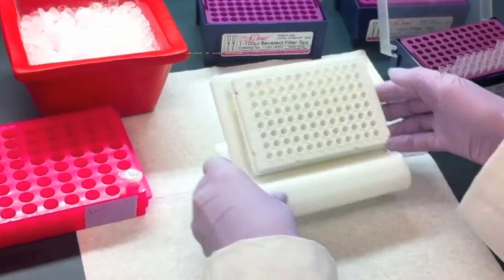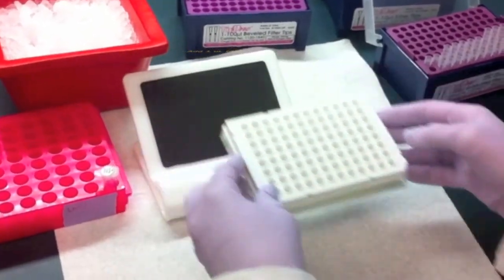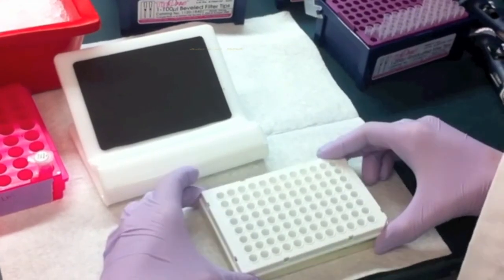Next, gently tap the plate on a flat surface to pull down any master mix or DNA sample.